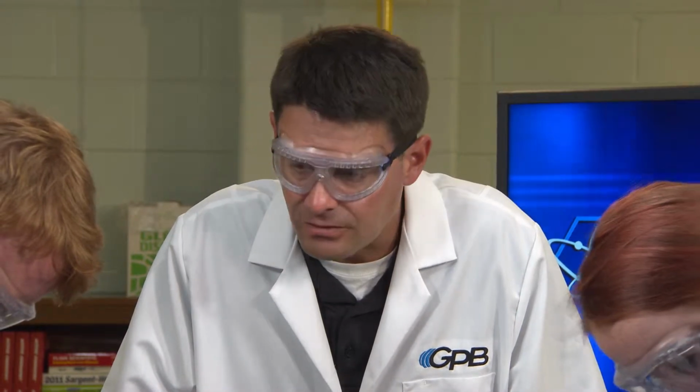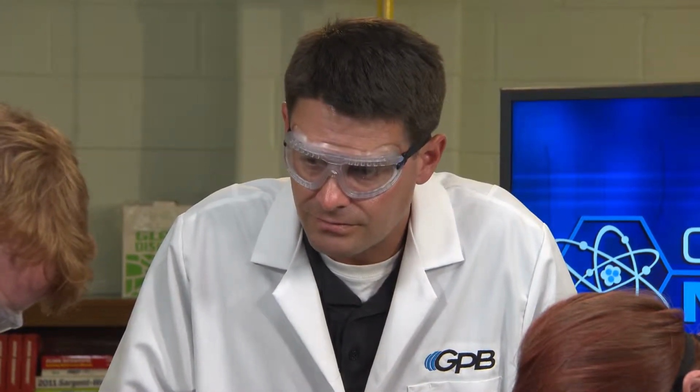So be sure you're placing the correct solution in the right wells.